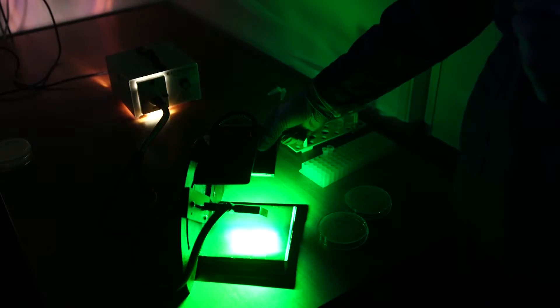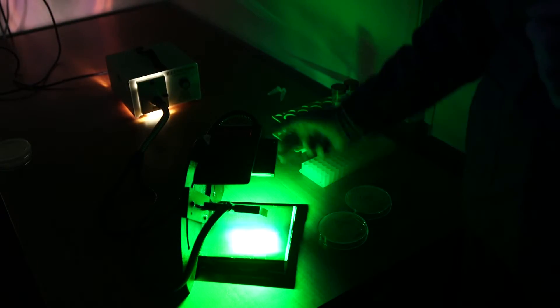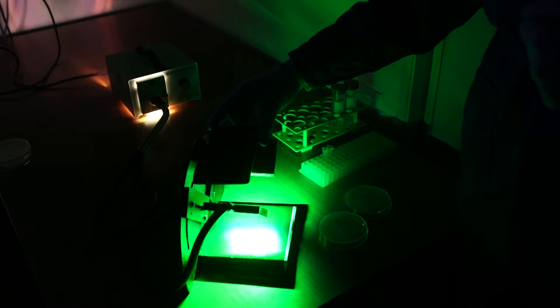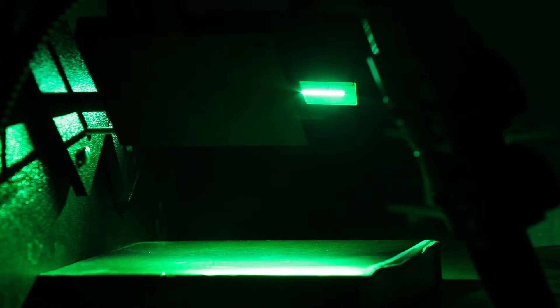Here we are in the dark room. I've set up our illuminator tool. We've got two green excitation filters tuned to the wavelength of RFP excitation and one red emission filter tuned to the wavelength of RFP emission. What this is going to allow us to do is to stimulate specifically the red fluorescent protein and then observe specifically the fluorescence light that is emitted by RFP fluorescence. With this setup, just by eye, we'll be able to solve the mystery of which of our two strains is transformed with the red fluorescent protein.